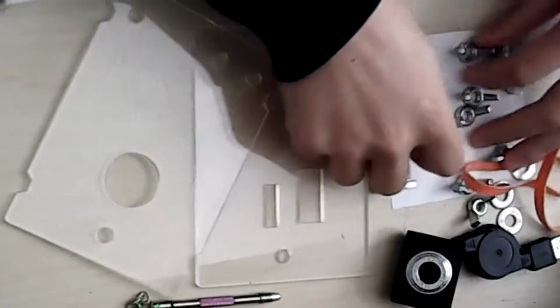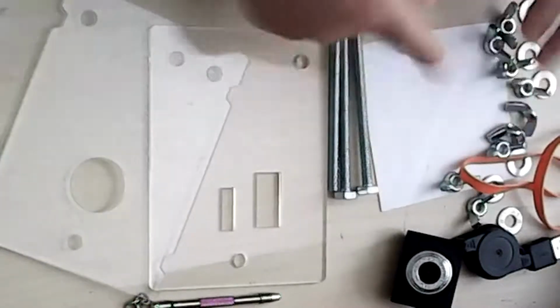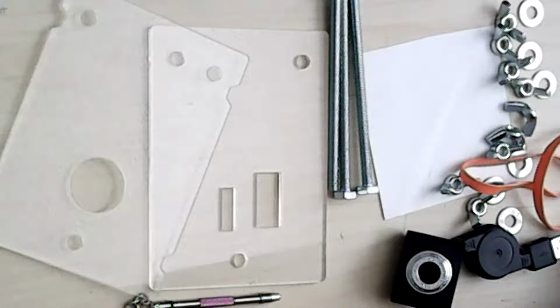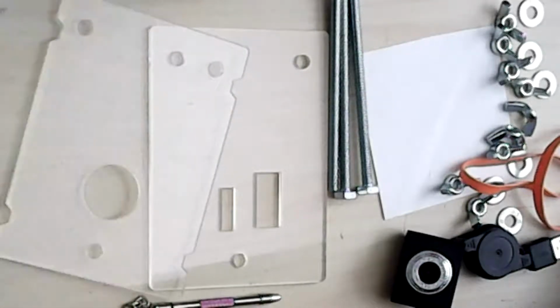And then for this dissecting microscope, we will need just a white piece of paper. You can use a Post-it note and just a little bit of tape. Yeah, we can get started. So the first thing to do is to build the stage, which will hold the microscope, and that's actually the bulk of the work.